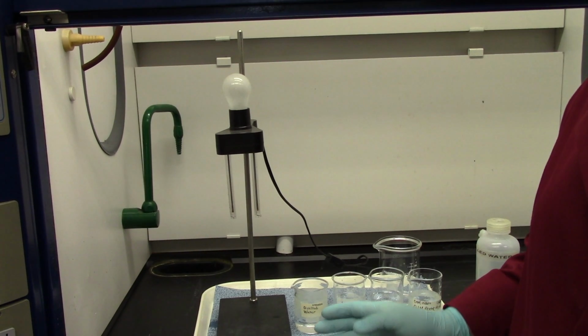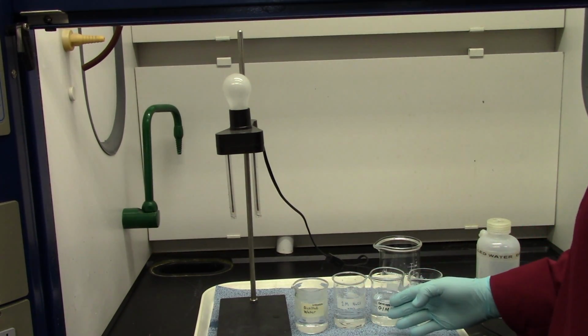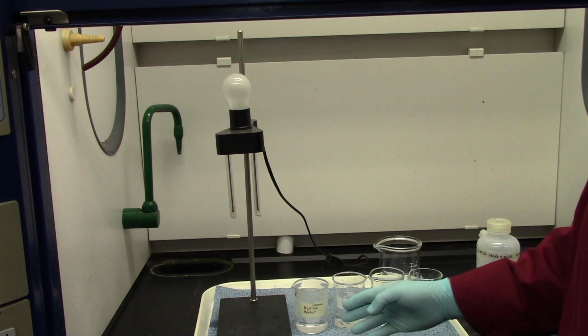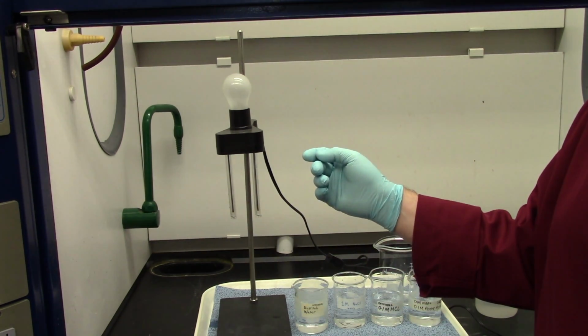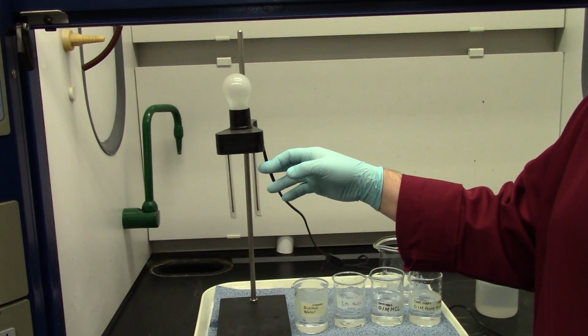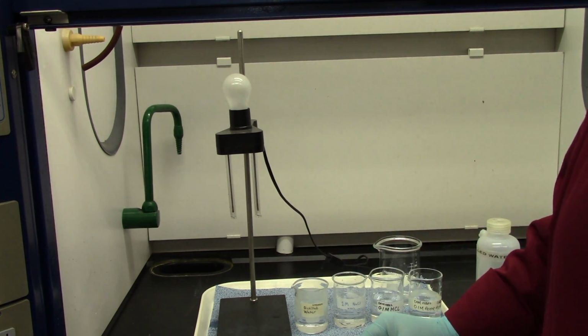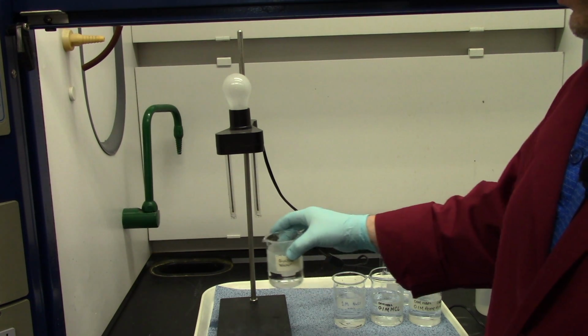All right, guys, now we're going to start by doing this electricity experiment. What we're going to do is take one of these beakers that are filled with a solution. Some of them are strong, some of them are weak, some of them are just not electrolytes at all. And we're going to put them between these two electrodes. Now, I can assure you this is plugged in, but the circuit is broken right here. So the only thing that's going to connect this wire to this wire is the solution that we put under it. Okay? So let's start off with everybody's favorite, water.